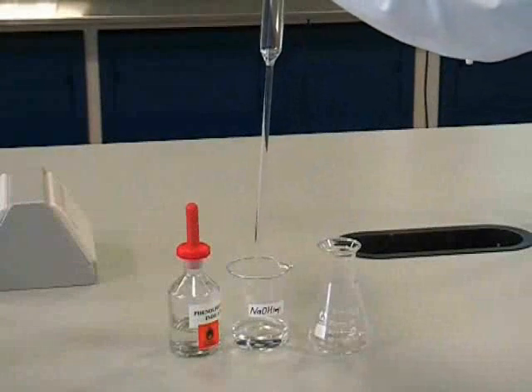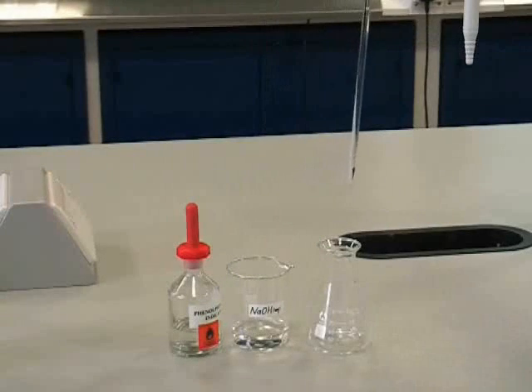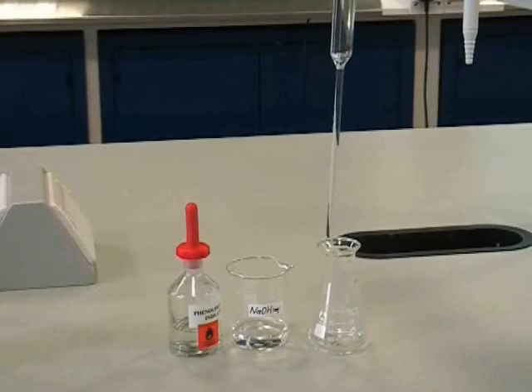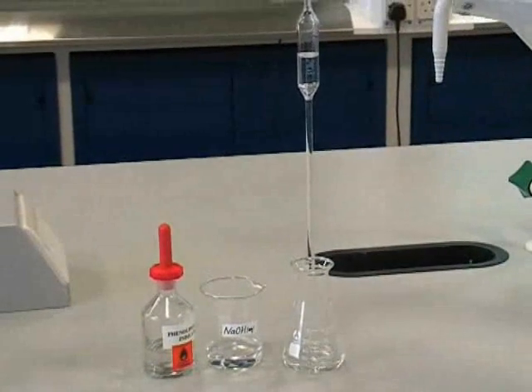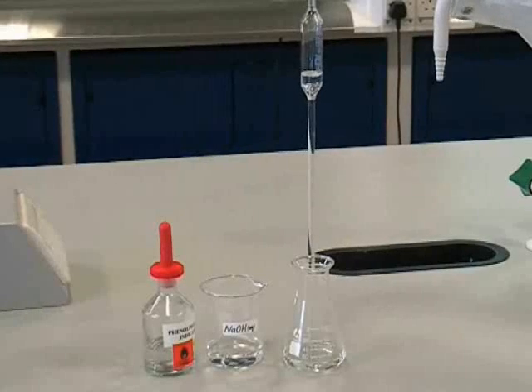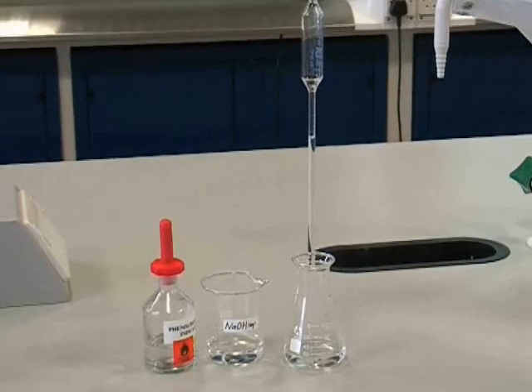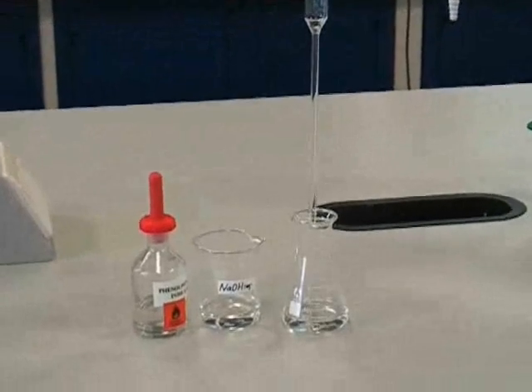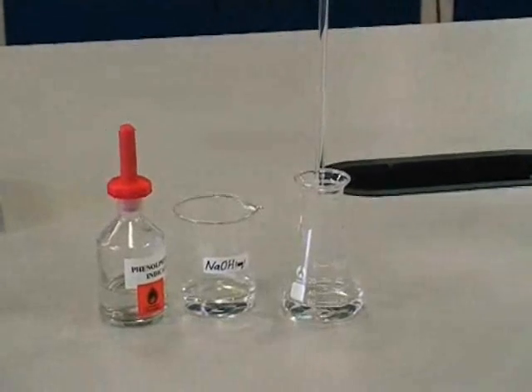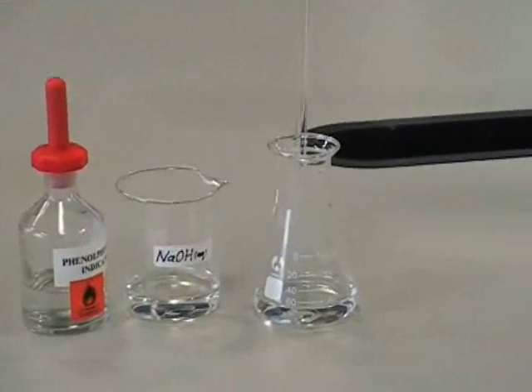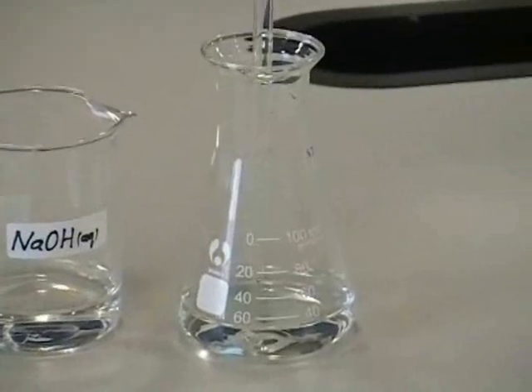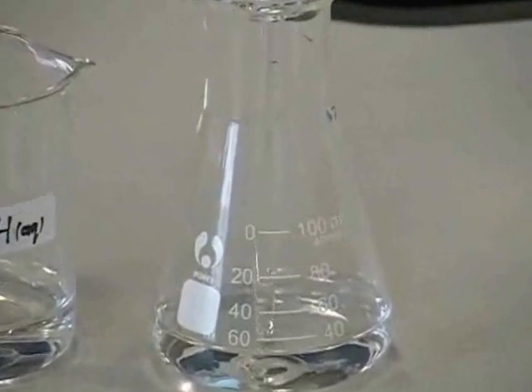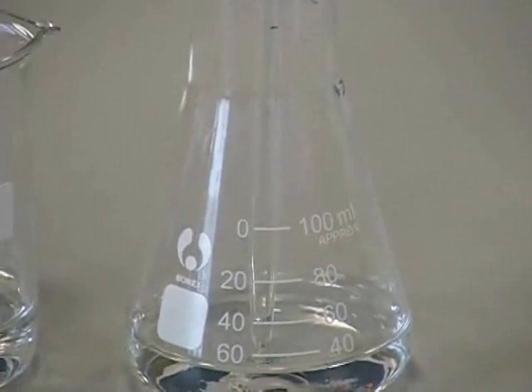This can now be transferred to a clean conical flask. We allow the solution to run under gravity into the flask by removing our thumb. It's important to recognize that the pipette is calibrated in such a way that you should always touch the pipette onto the surface of the liquid in the flask to ensure that the correct volume has been transferred. There will always be a small amount of liquid left in the pipette, but that's meant to be there, so don't worry about it.